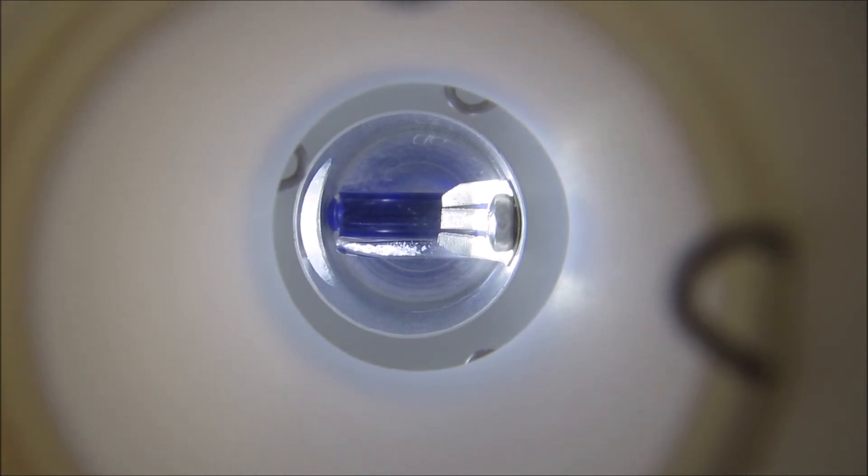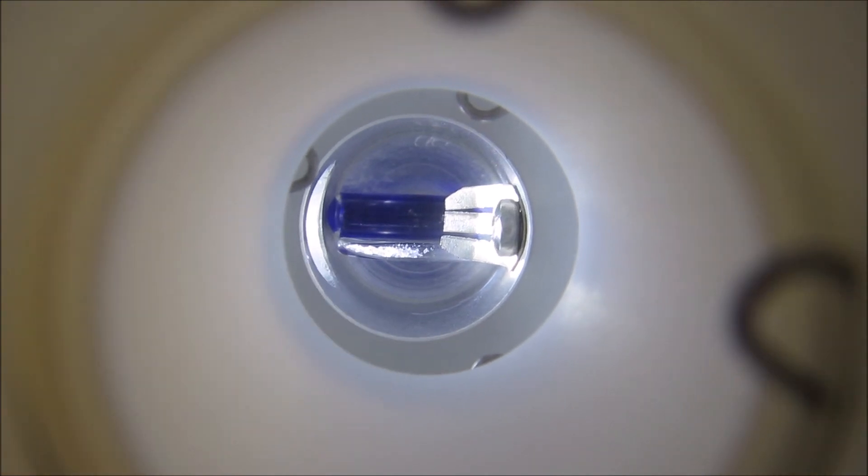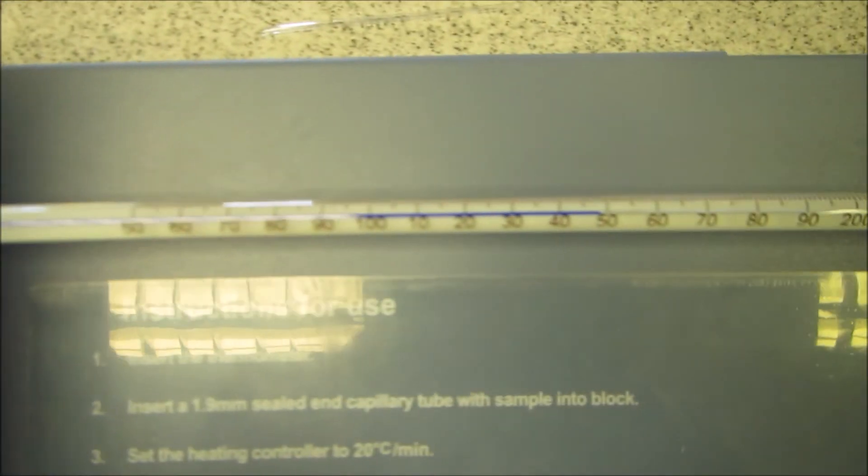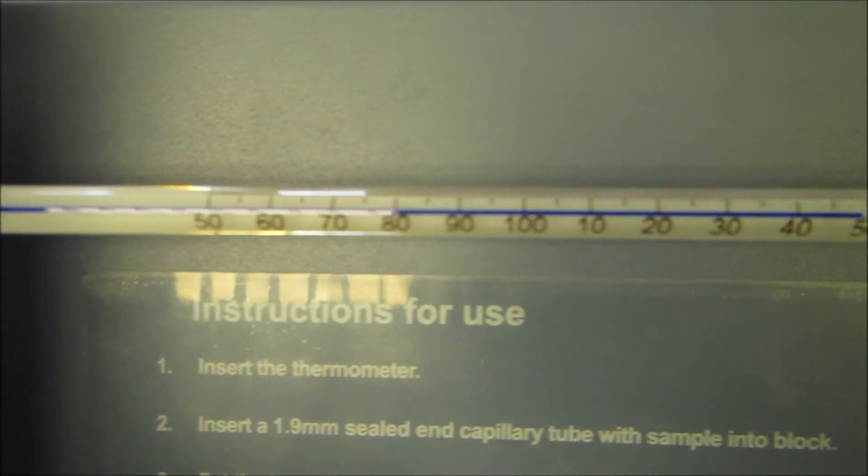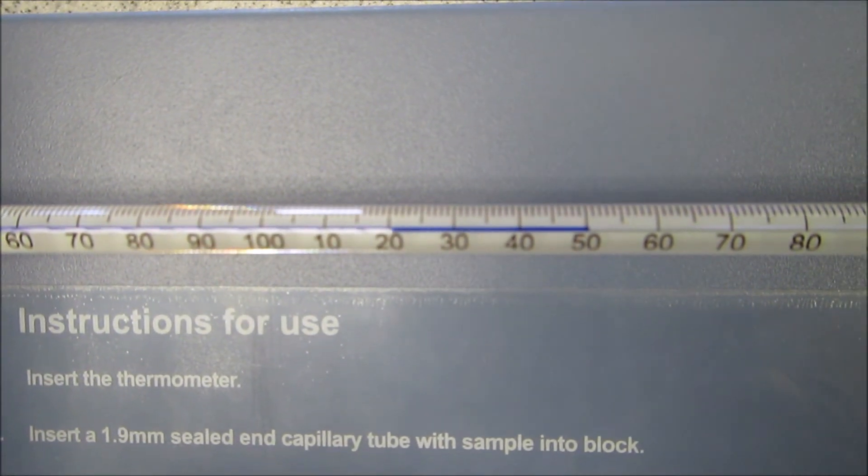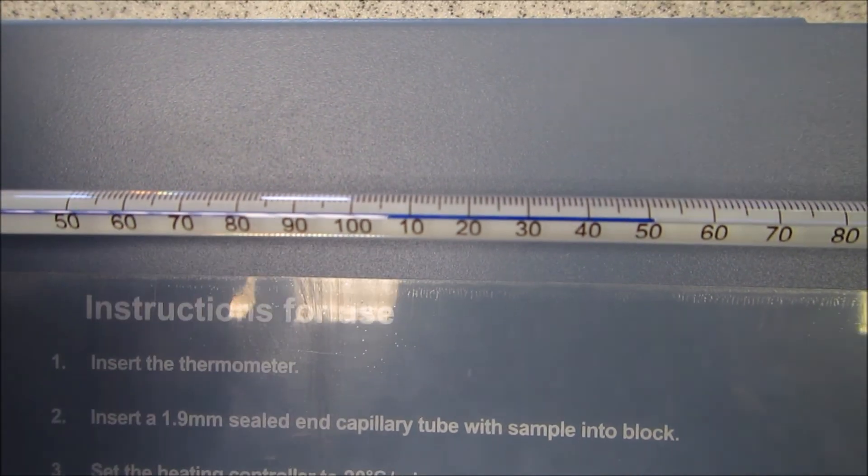So you can see it's starting to go. There's now a gap in the tube. So I'm just going to call that the end point now. And I'll show you the thermometer. So now you need to repeat and do the same again.